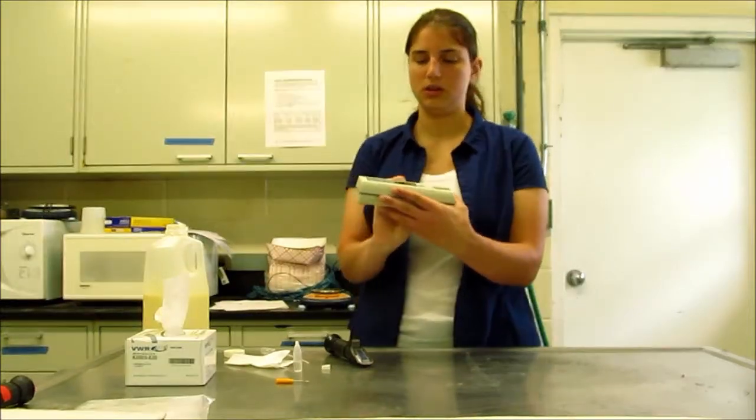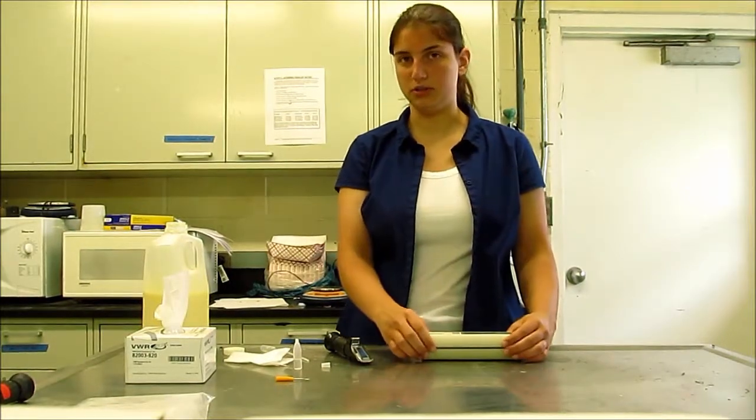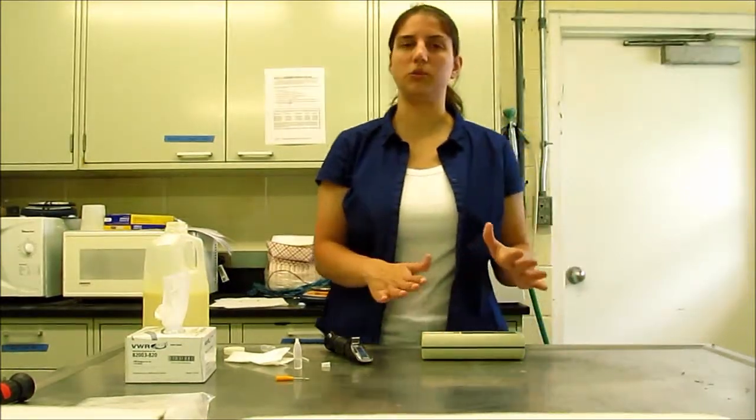This particular one is 15.9, which, as you notice, is not above 22 percent. So this is not a colostrum that we would want to use for calves.